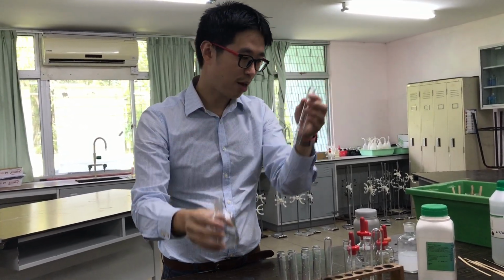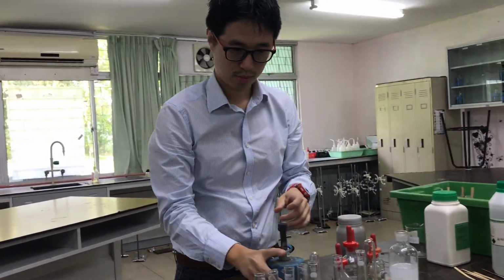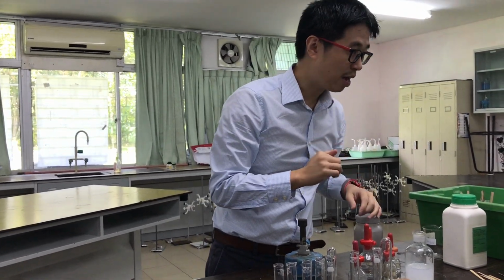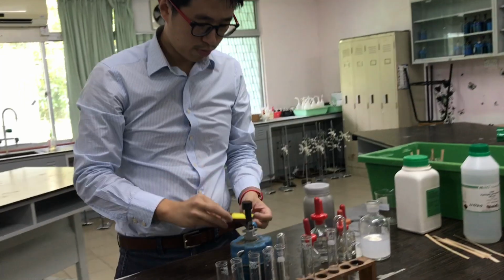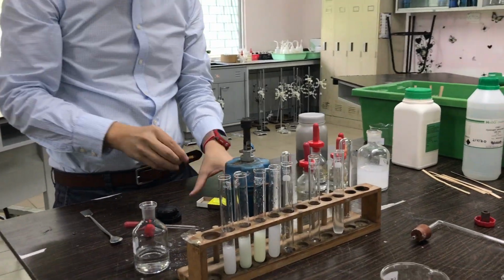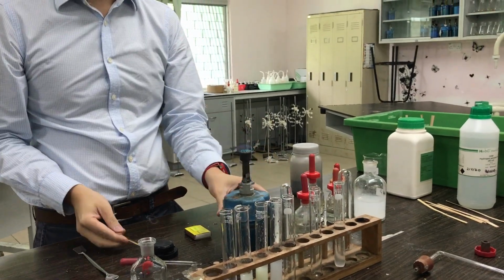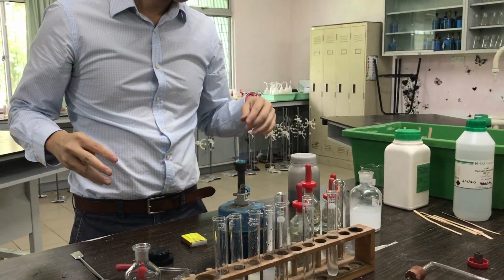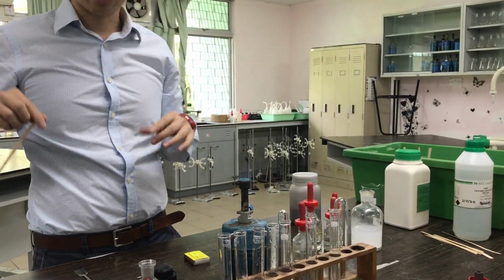Okay, come and observe what happened. I better get this ready first. Where's my lighter? I asked for a lighter just now. And then I can use a match. But grab a lighter also. The match always doesn't work. Okay. It's fine. It works now. Okay. All right. Ready? Don't smell it. It's not very good for your lung.